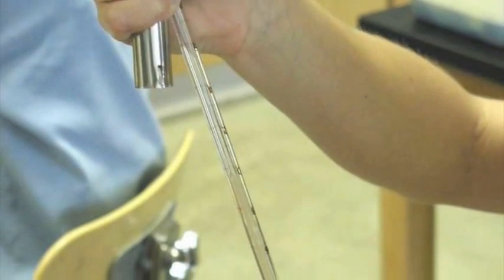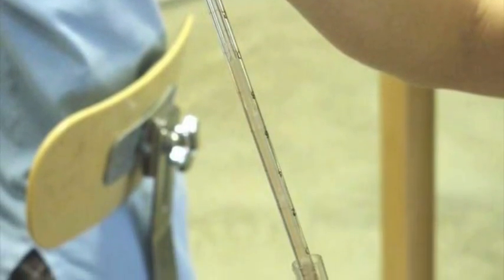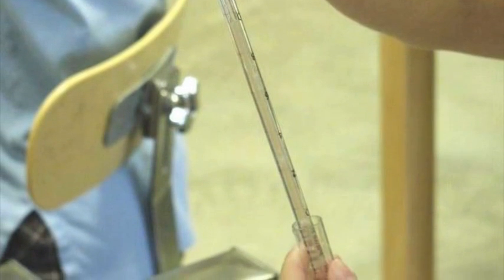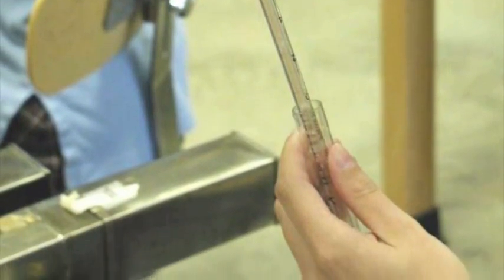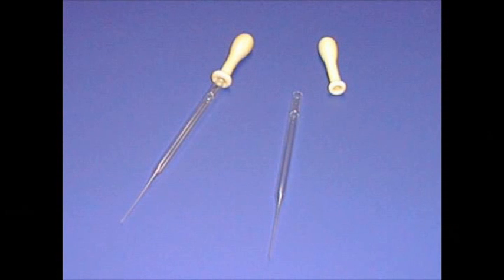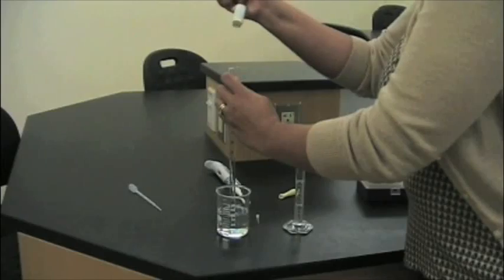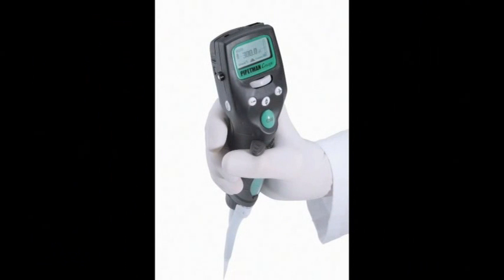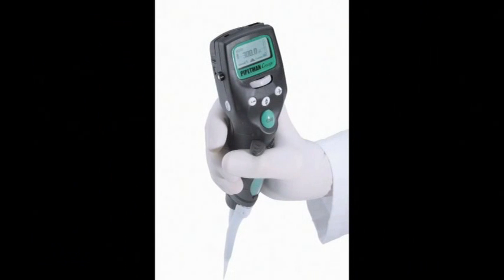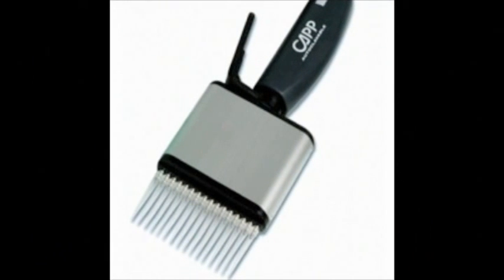Is there more than one type of pipette available? Here we go. Let us demystify pipetting. You may have correctly guessed that there are several different types of pipettes available. In this film, we have primarily featured pipettes most frequently used in school laboratories.